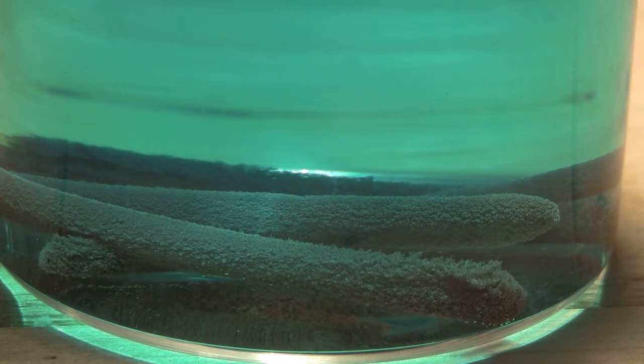I will be preparing copper powder to add to my element collection, but I also have potential use for it as a catalyst to oxidize ethanol to acetaldehyde.